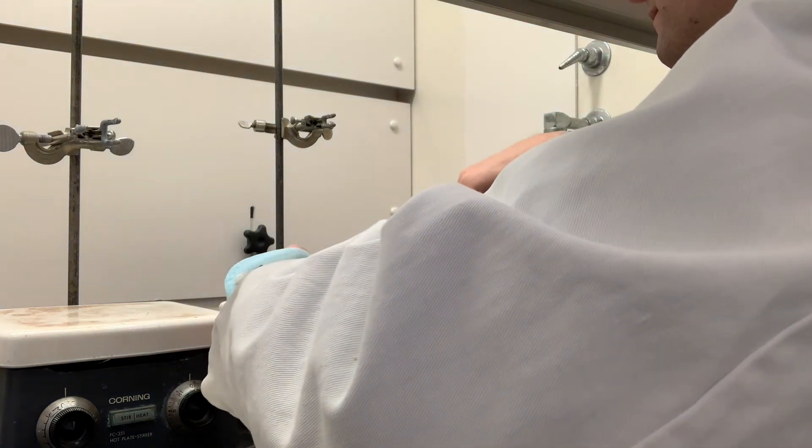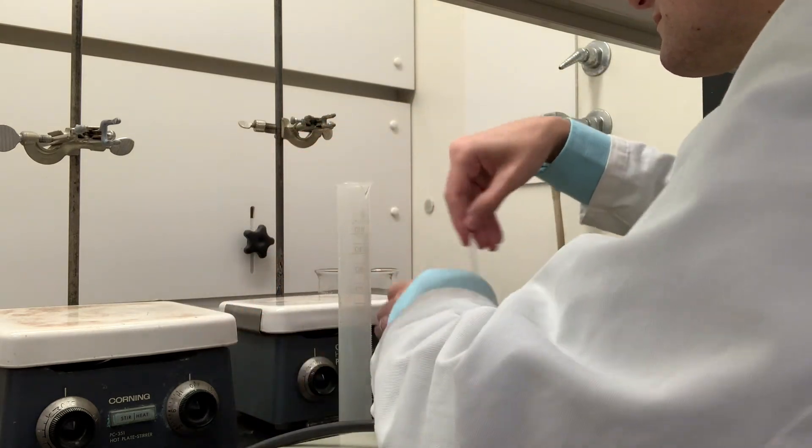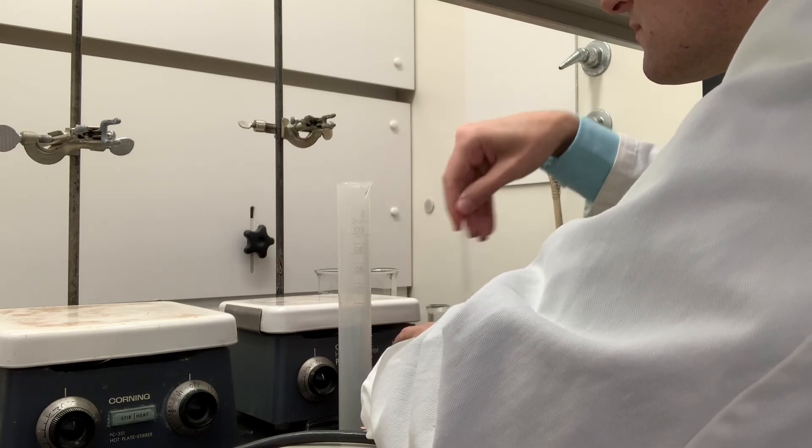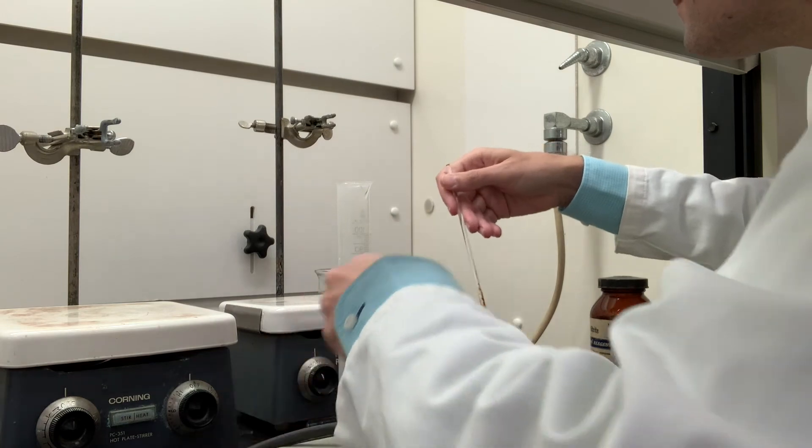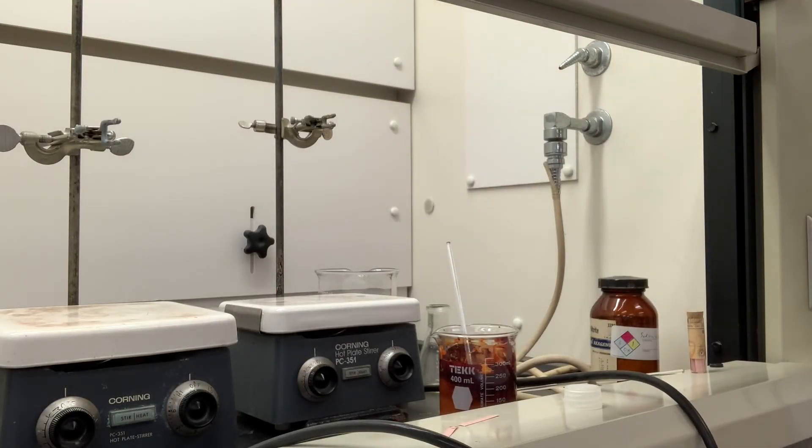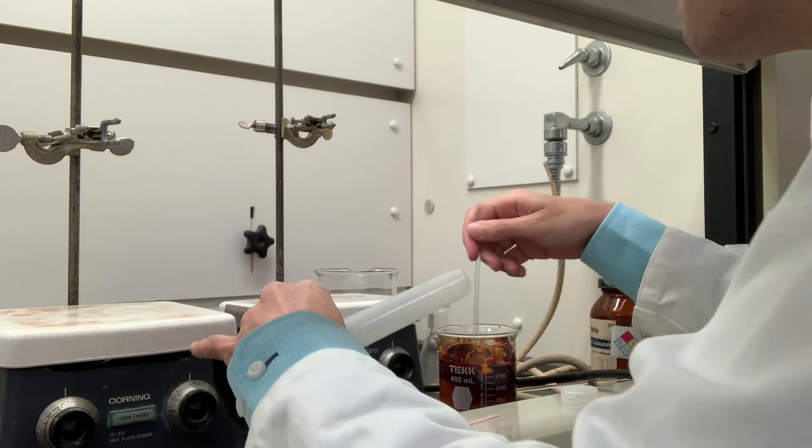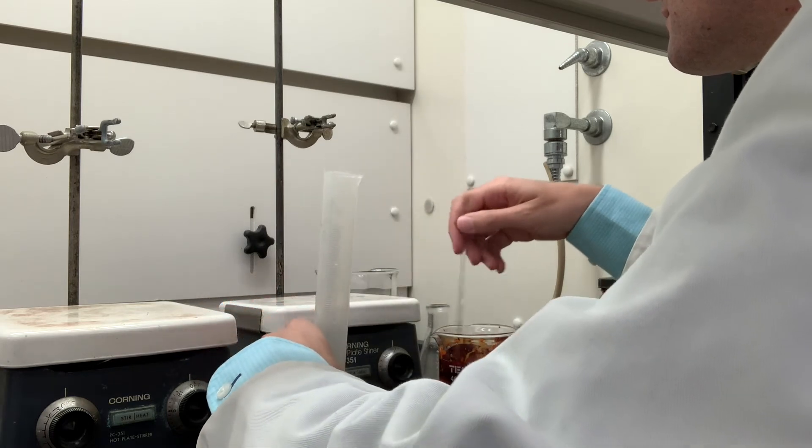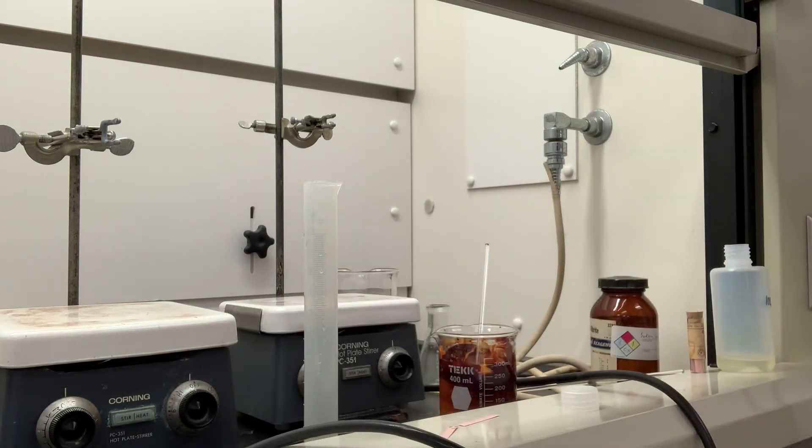Definitely not glue. Need some more of this. Button up my lab coat, this is a very good dye that permanently stains things. I should have dressed more appropriately for today's lab.